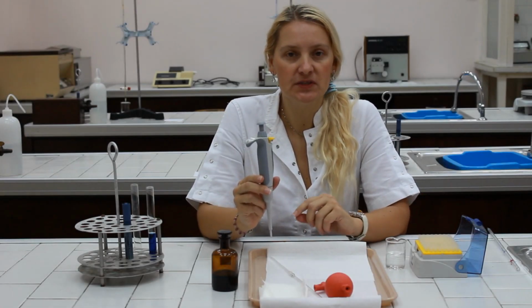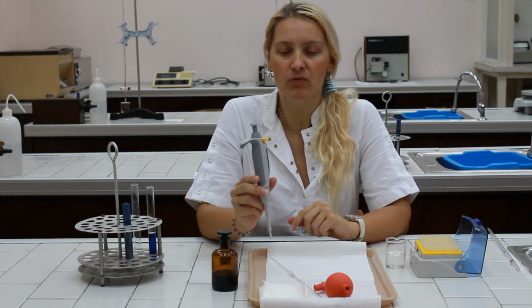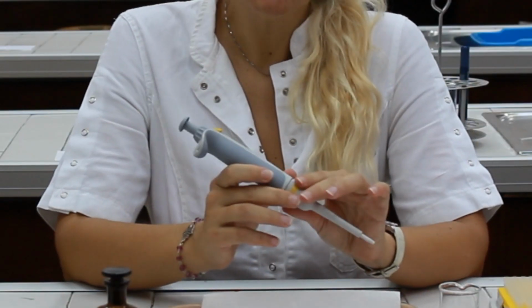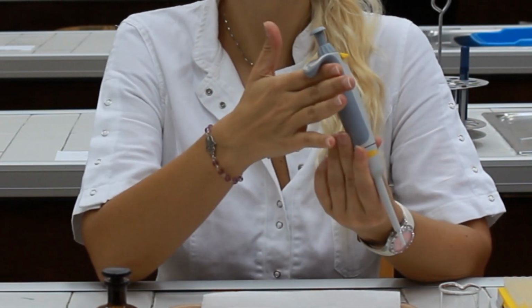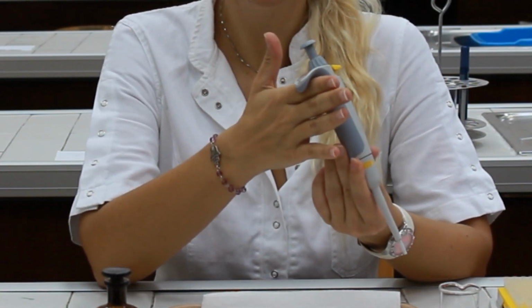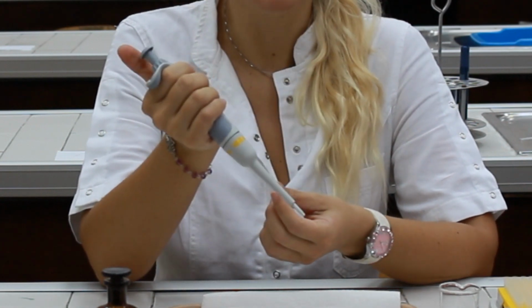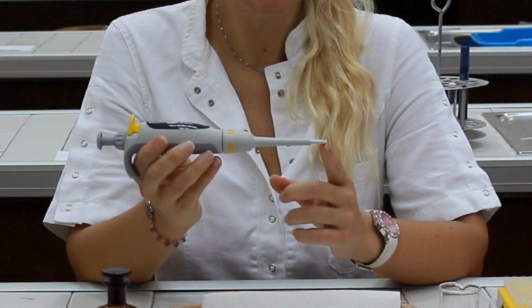Micropipettes are used to safely and accurately pick up and transfer microvolumes of samples or liquids. The micropipette itself has several parts. It has a pipette holder, which is used to position the pipette firmly in your hand. It has the end, where the sterile tip goes.